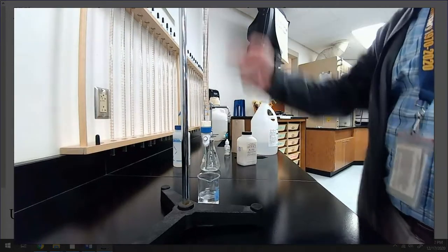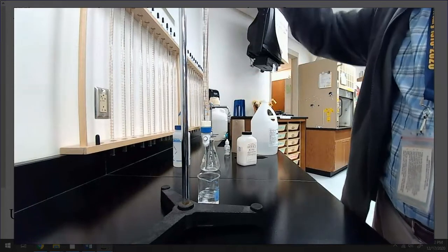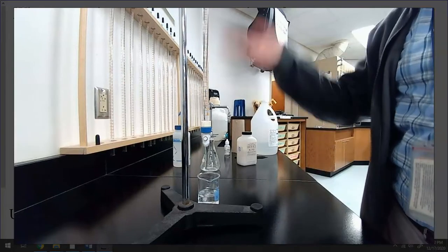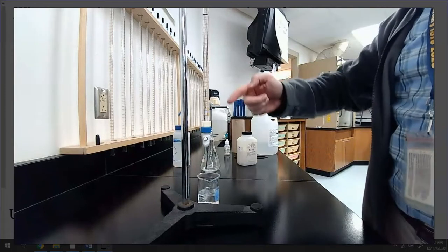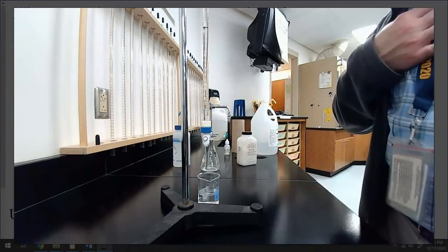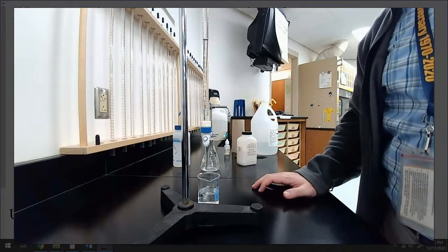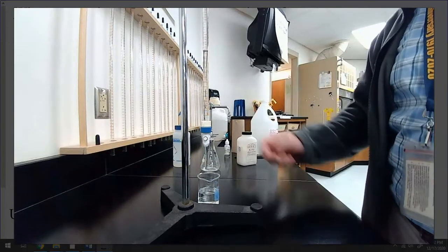Now, the reason why you want to rinse it, like I kind of said a little bit earlier, is I don't know what's been in here, and I don't know what's still in here, right? So in an ideal world, there's nothing, and it's clean, and that's all well and good, but sometimes it's just not. So I do a good rinse with what I'm actually going to use as my titrant, to make sure that when I actually run my titration, the molarity that I think I have is the molarity that I actually have. So this is almost done rinsing.